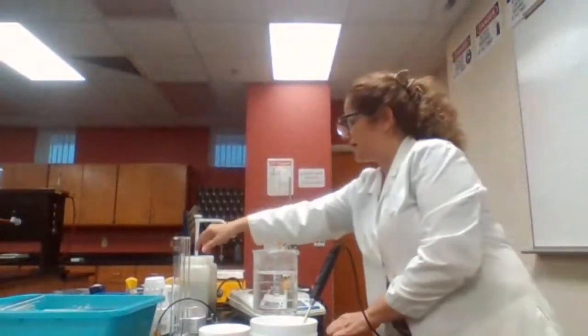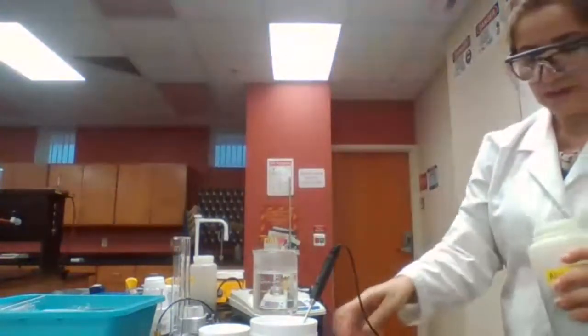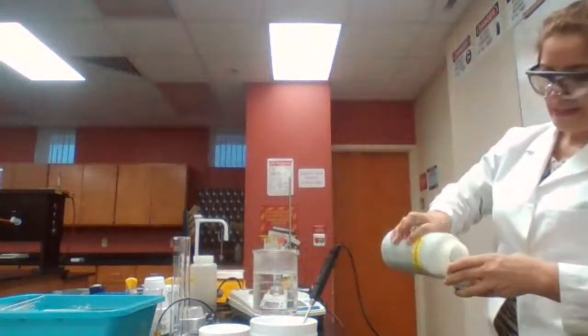And why do I want you to take a screenshot? Because I want you to include that in your lab later on.